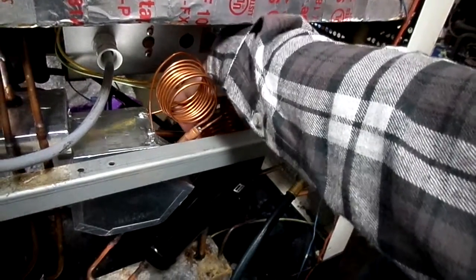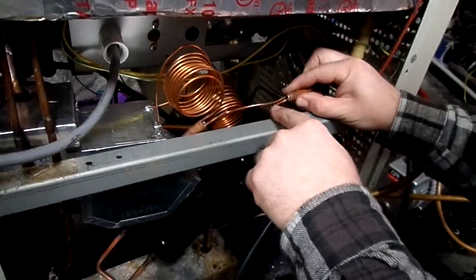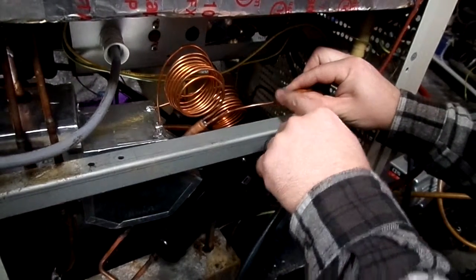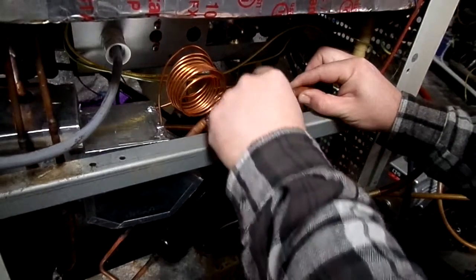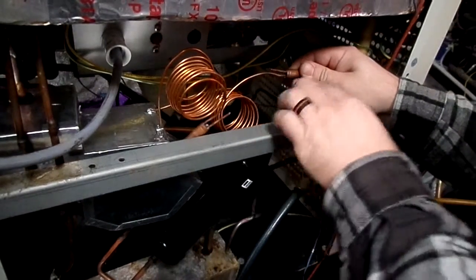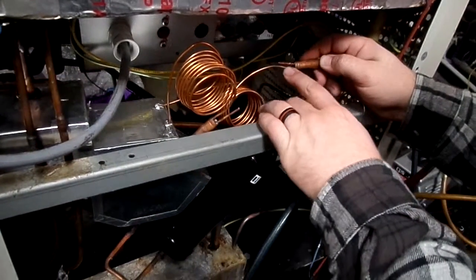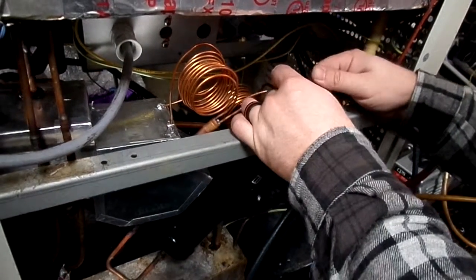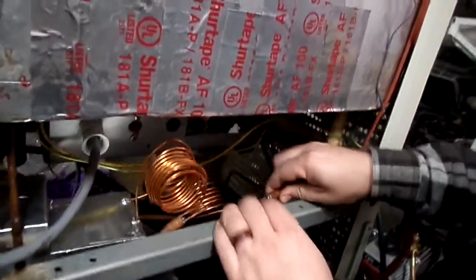Okay. And you want to keep your lines here fairly level. You don't want this at the bottom. You don't want it to sit like this, because if something gets into this capillary tube, it'll clog it. So you want to keep it at least level, if not going at the top when it's strapped in place.